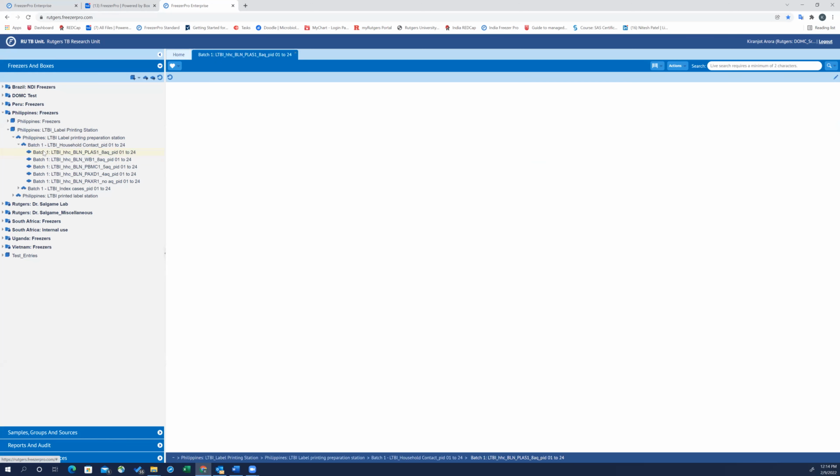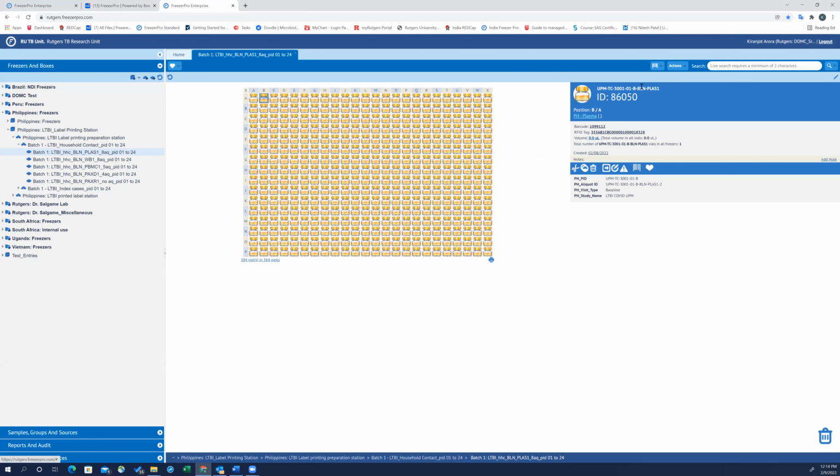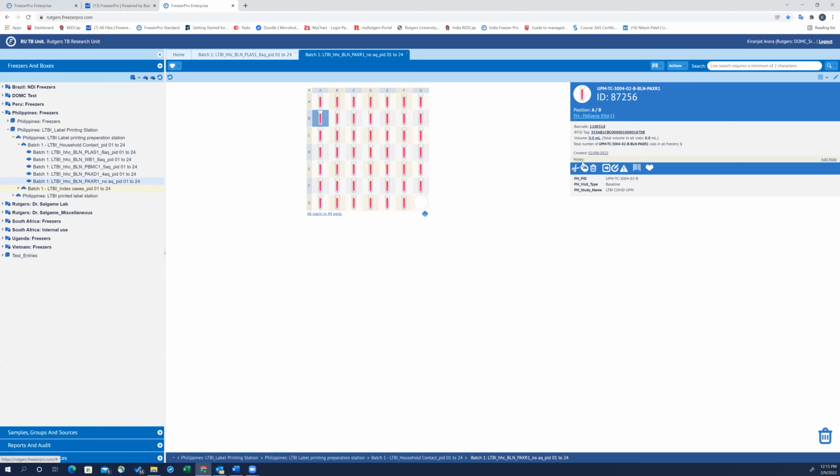And now let's double check the info. So see now, initially in the beginning of the video, when I was showing what I'm changing, the information regarding visit type was missing. Now it is here for all of these. I'll check another one. So the RNA, since this is not aliquoted, there are no aliquots. You don't see aliquot ID here, but the sample name has this information.